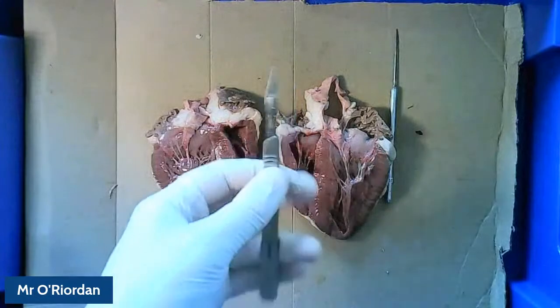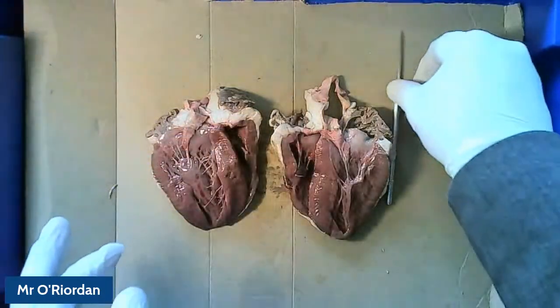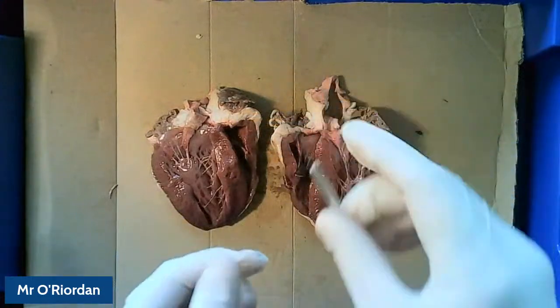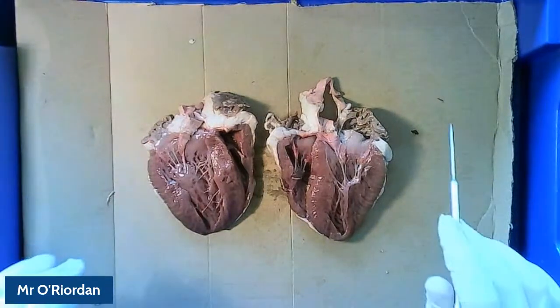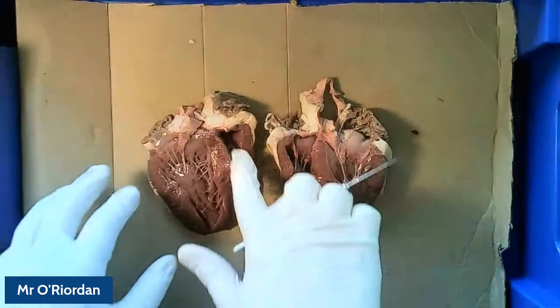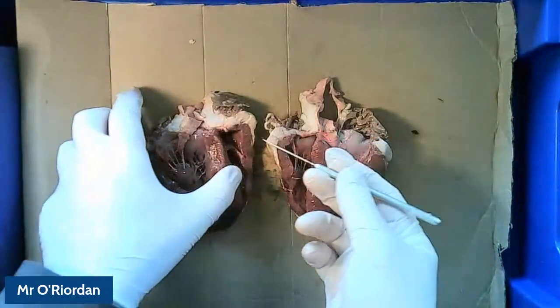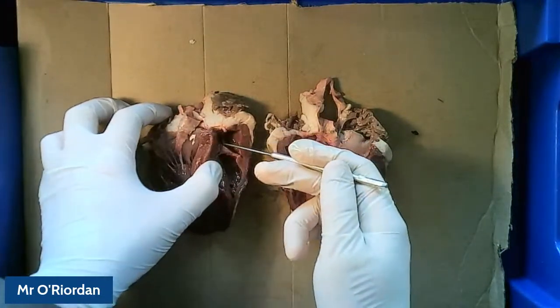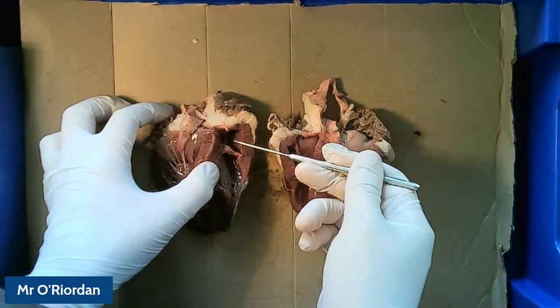I'm putting my scalpel safely away and using my pointer to point at different parts. What we can see, first of all very prominently, is on the thicker side of the heart — which is the left side, even though it's on the right because I have cut and flipped it. We can see this area here — that is the left atrium, that first chamber where blood is being pumped into.